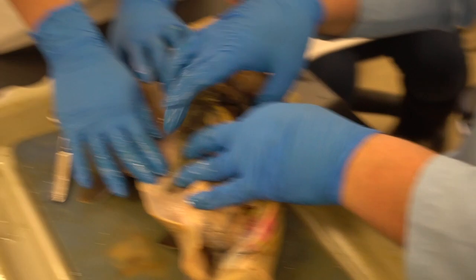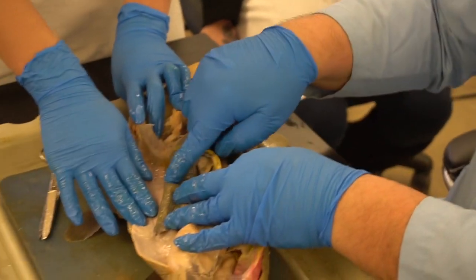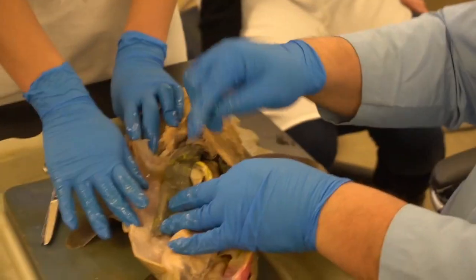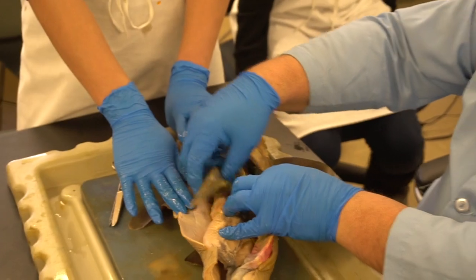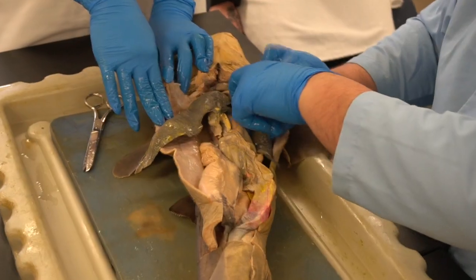Okay, what side is this, right or left? Right lateral. Okay, this is the right. Looks like it's on the left, right? But we're looking from the perspective of the animal. Okay, this is the right side. All right, so this is the right lobe. The central lobe is much smaller, and the left lobe.